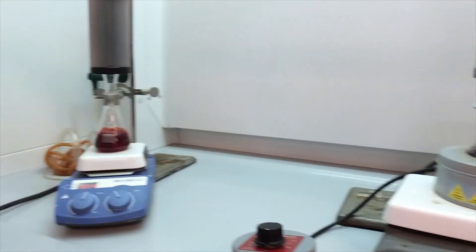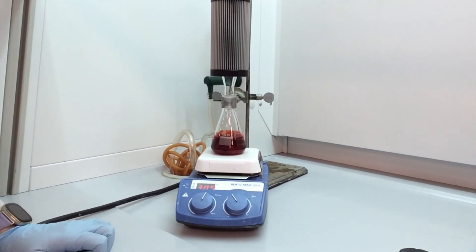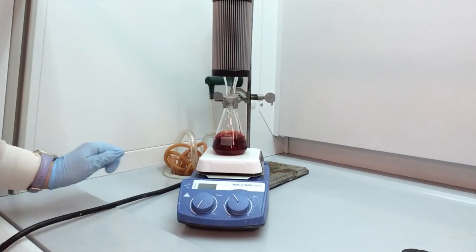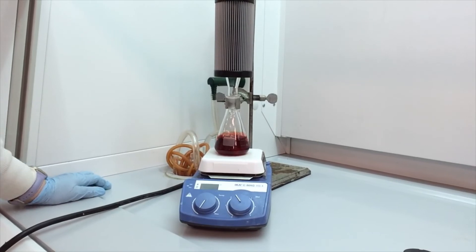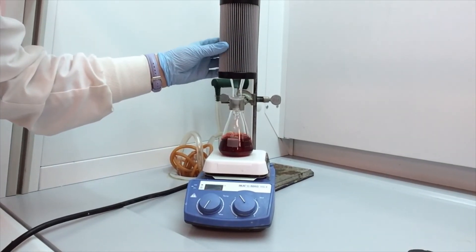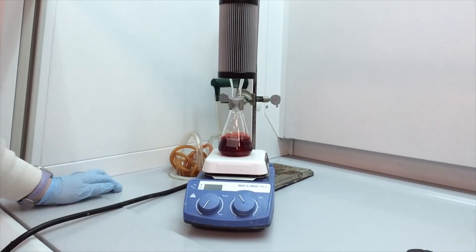If you were heating with this style, just turn that off. Wait for it to cool down. Again, leave the condenser on until the solvent stops dripping.